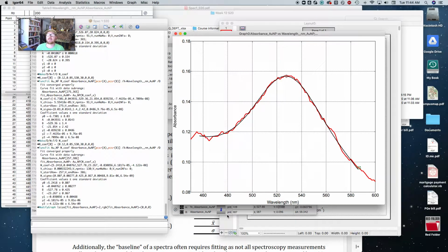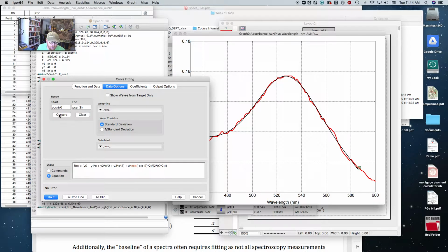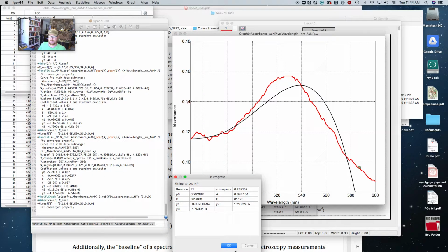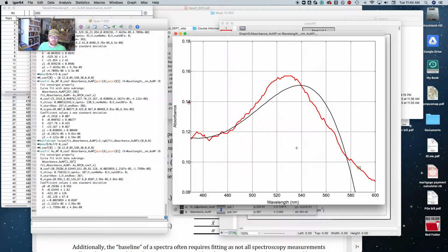So again, if you're struggling with getting these things to fit, just try only fitting the peak, like narrow down the peak. Using these cursors, I think really helps. And under curve fitting on the data options menu, pushing that cursors button, I think that makes a big difference. And again, I had the best success on the baseline of this gold nanoparticle by doing a polynomial. So that's y0 plus y1 times x plus y2 times x squared plus y3 times x cubed. And then again, fiddle around with these coefficients and push this graph now button, right? And that's how you can really see, oops, now you can see, look, it got totally messed up.